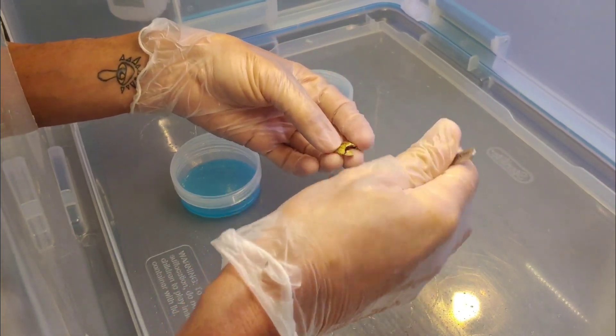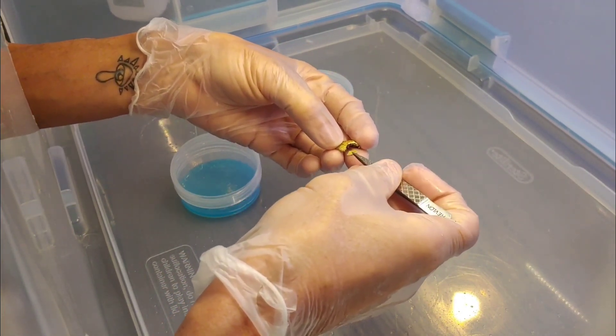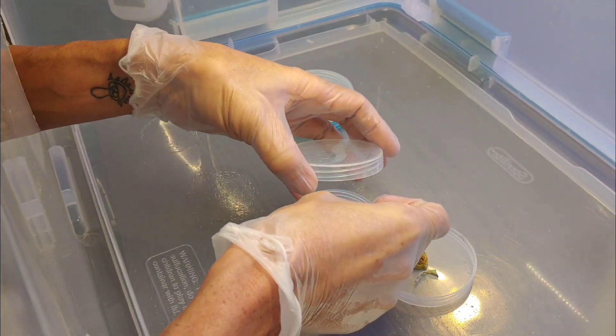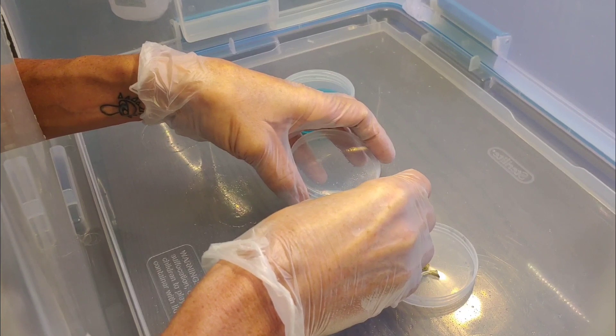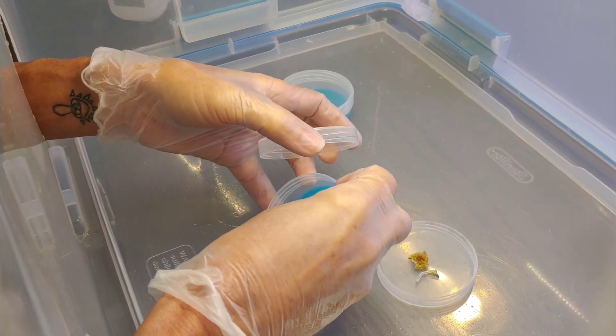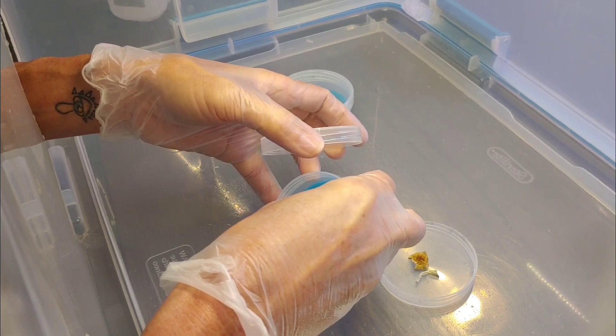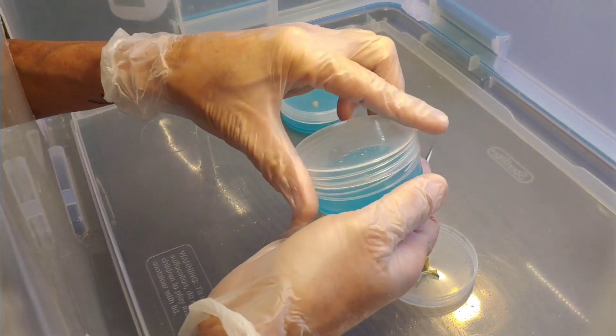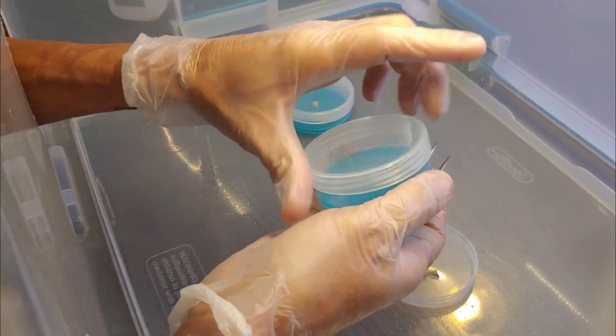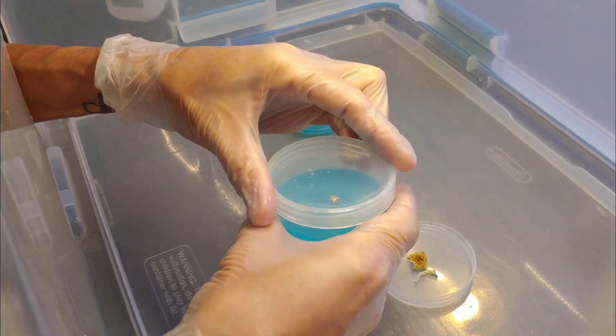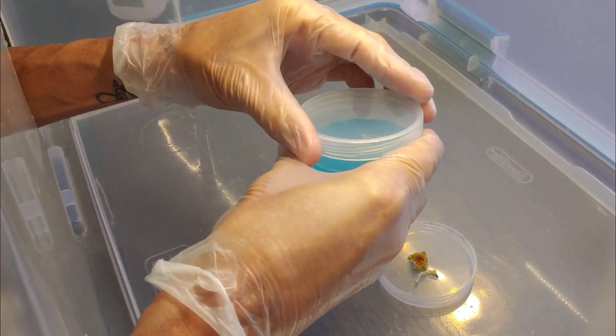So I am anticipating that I am going to have to do some agar transfers to get this working. But this is a good test to do because I have never done this before and who knows.